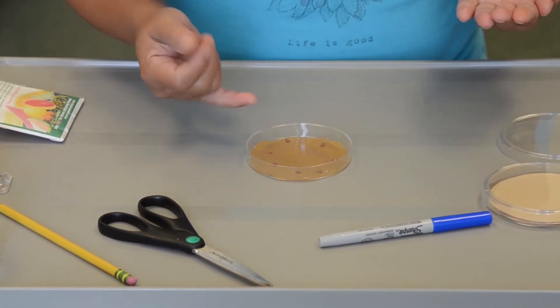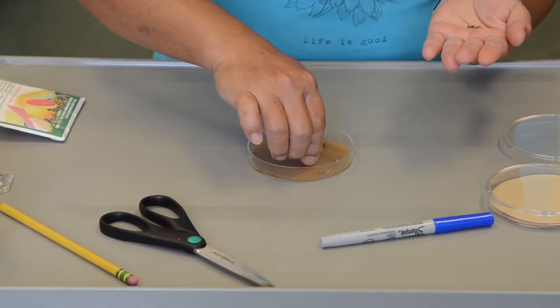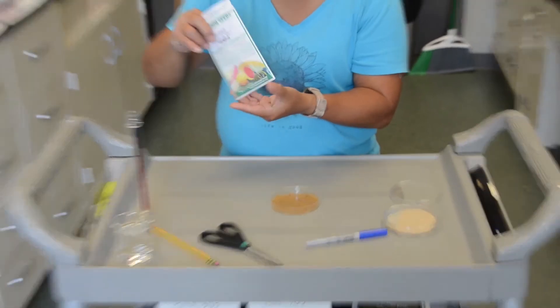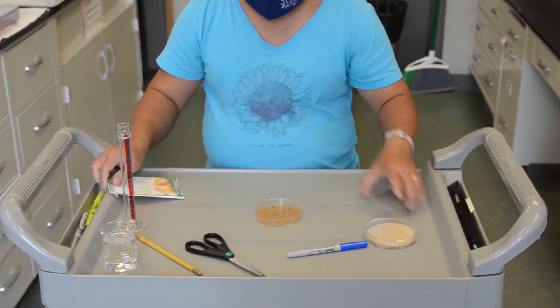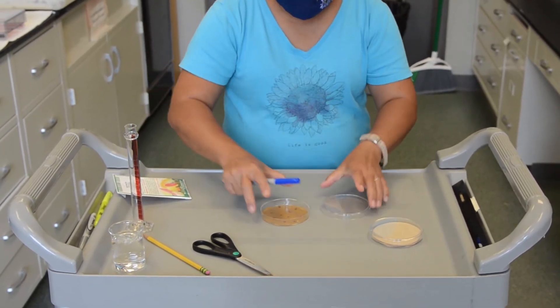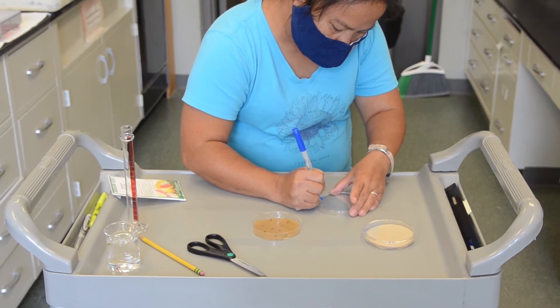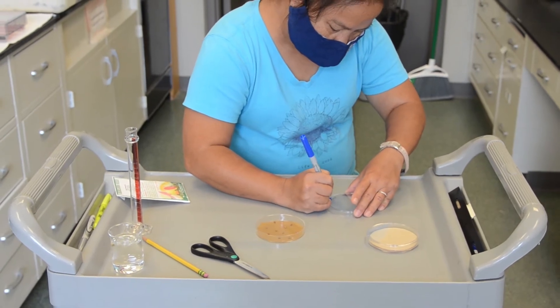So how many do I have so far? Three... seven. So I need to put three more. That's it. So after that, I will save the seed and then I will put the cover on top. But never forget to label what you do. For example, you use the radish seed. And today is the 14th.